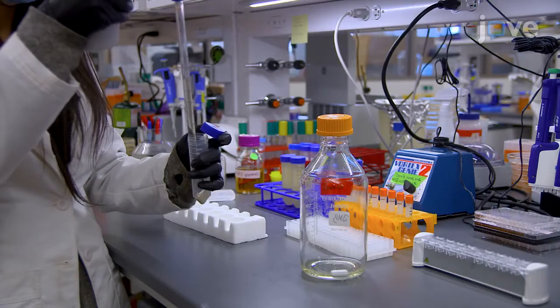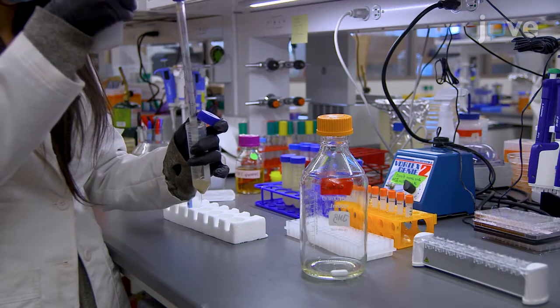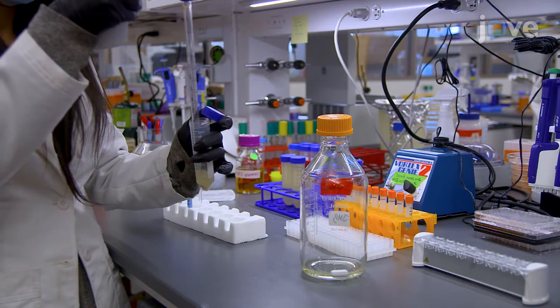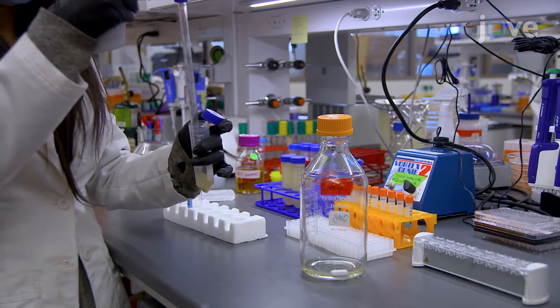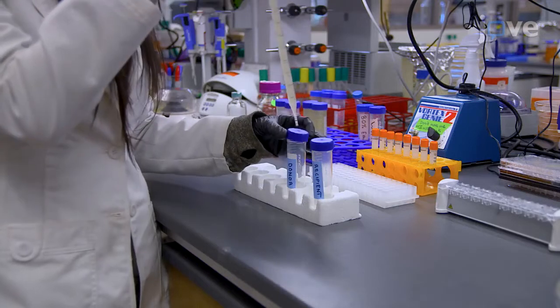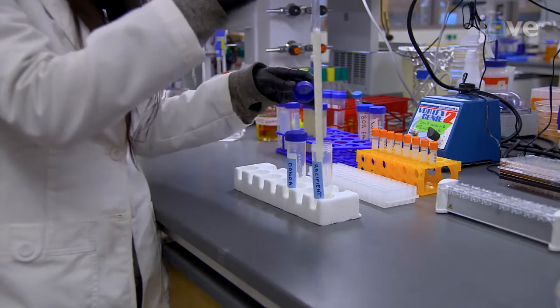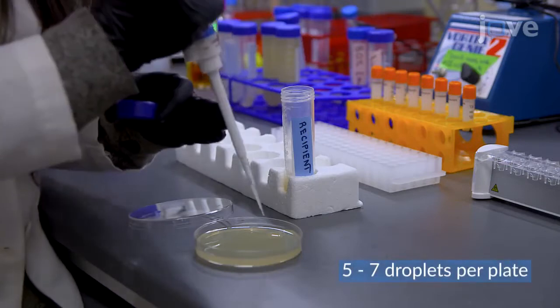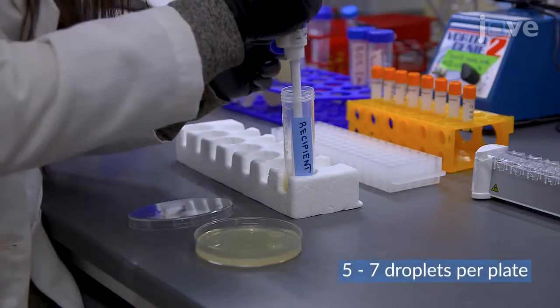Use a 10 mL serological pipette to re-suspend the donor strain pellet in 4.5 mL of LB supplemented with diaminopimelic acid. Transfer the re-suspended donor strain into the recipient strain tube and immediately distribute the mating suspension as individual 100 µL droplets.